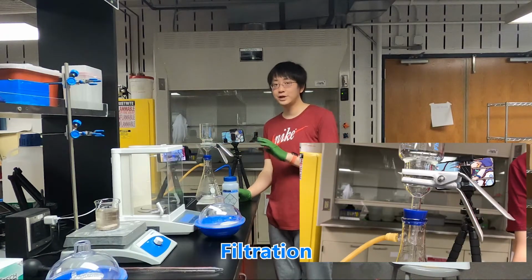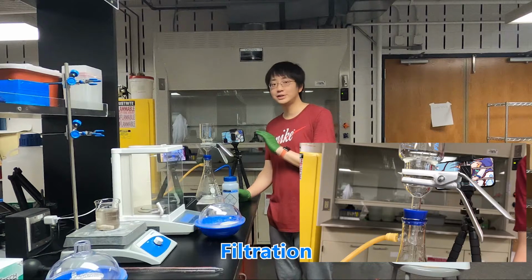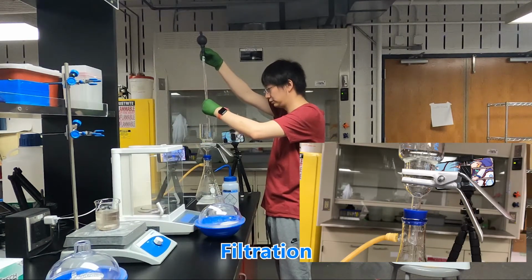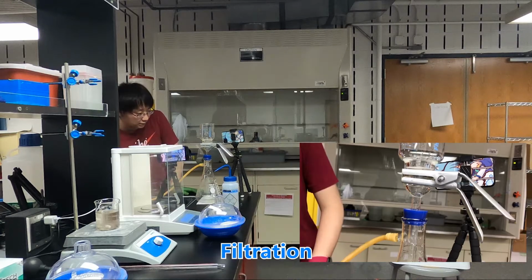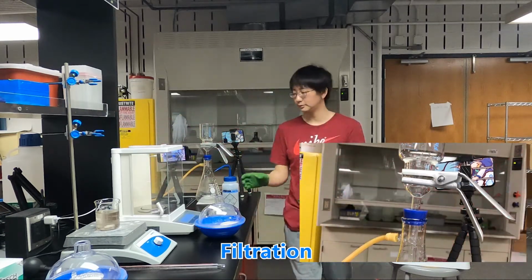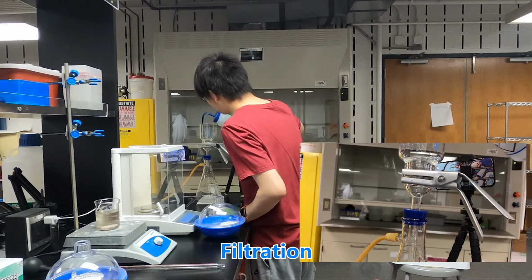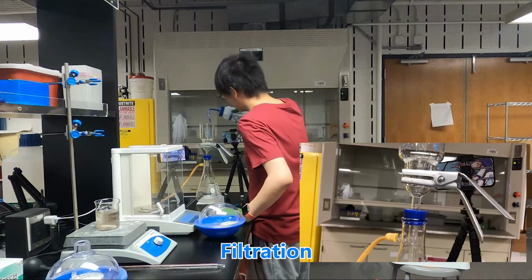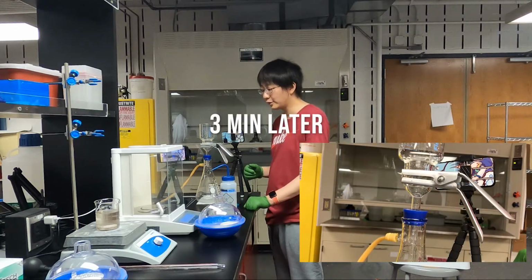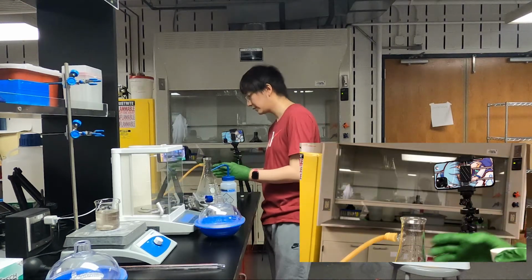Now we are going to transfer 50 milliliters of sample to this filtration system. And we need to make sure there are no residues on the top of the cap. And now we have filtered it for 3 minutes, and then we get the filtrate.